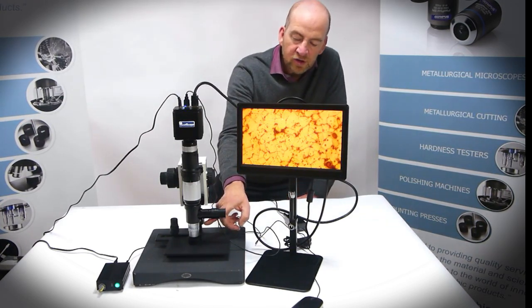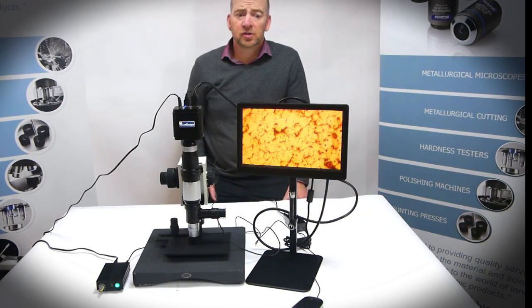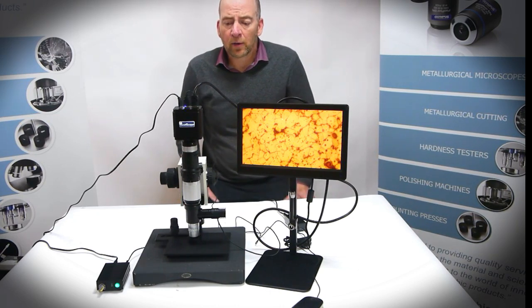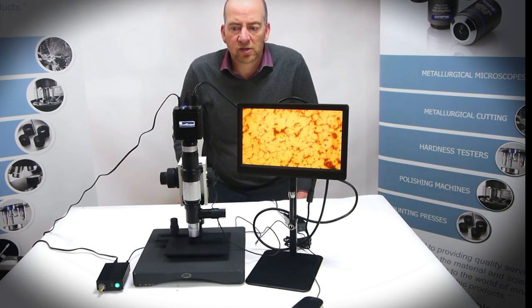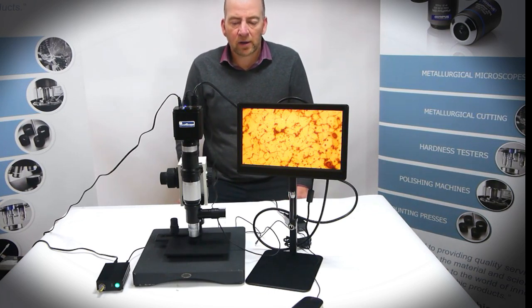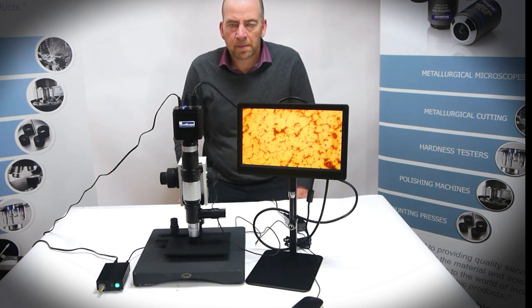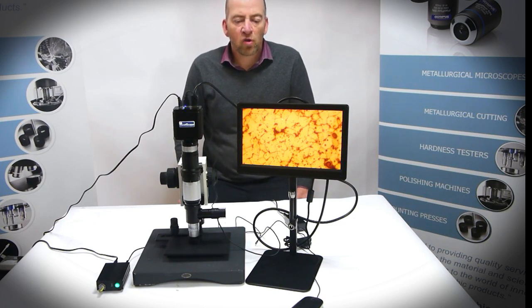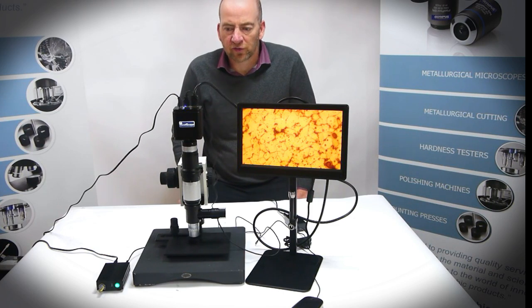We have the opportunity to change the objective lens. Here we're using a 50 times objective, allowing us to get more than 2000 times magnification. This system allows us to do image capture, measurement, annotation, and auto focus functions.